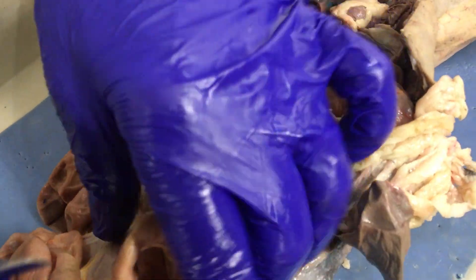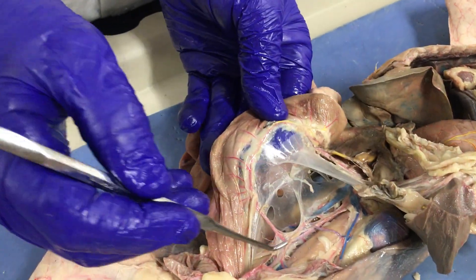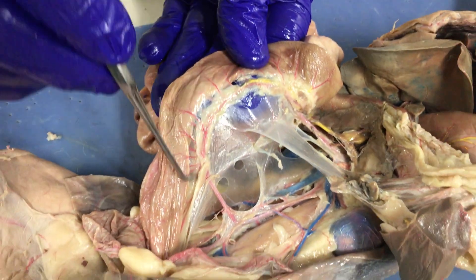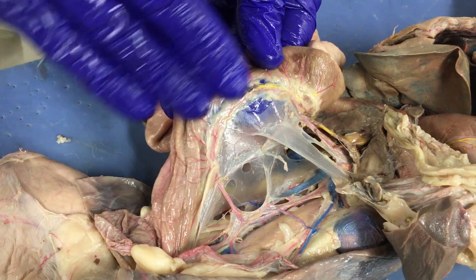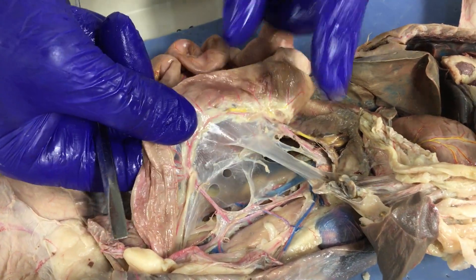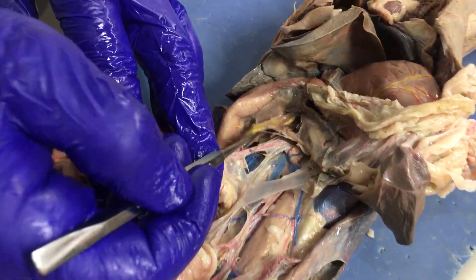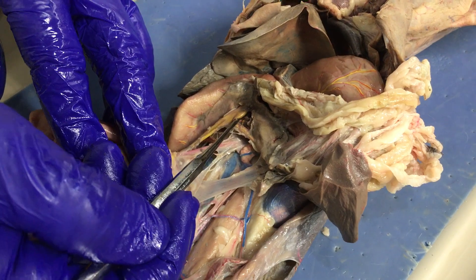The fourth one then is back down here where we started. This was the inferior mesenteric artery, so here's the inferior mesenteric vein draining blood away from the large intestine. So three veins: inferior mesenteric, superior mesenteric, splenic, and finally the portal.